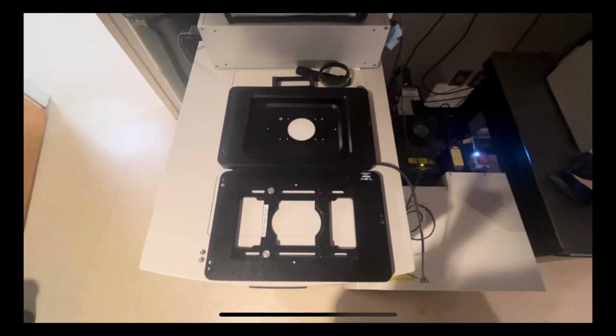So next I will show you how to set up your slide on the microscope. We've got 2 stages. We have a TIZ drive and a piezo drive. The difference between these 2 stages is that the piezo drive uses an external motor, which you can see here, and it actually has a cord attached to it, whereas the TIZ drive uses the internal motor of the microscope to change the Z position.